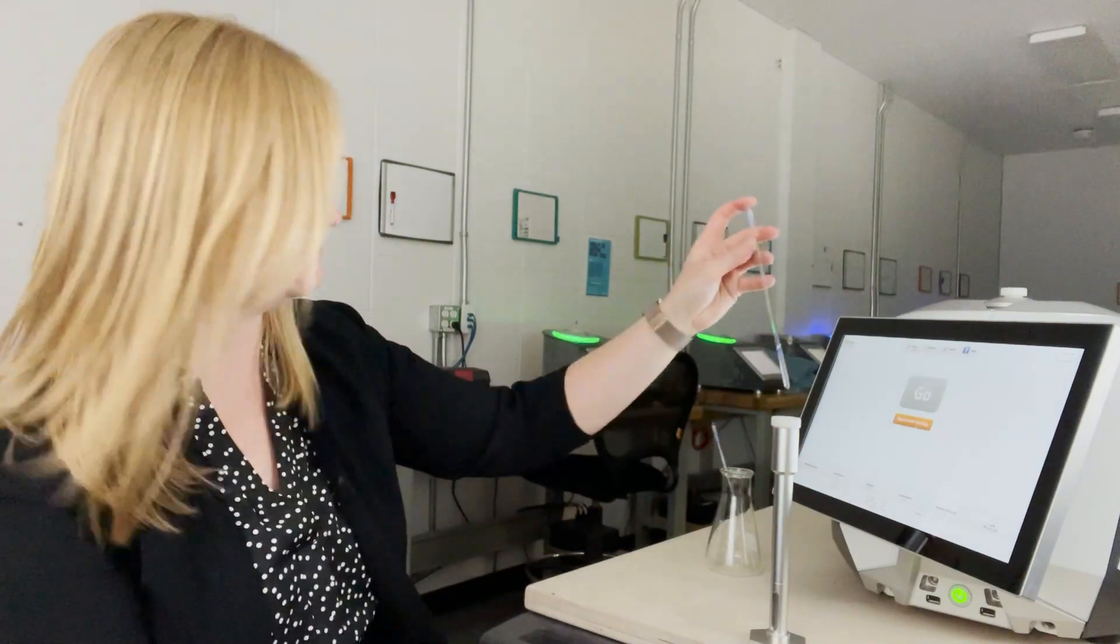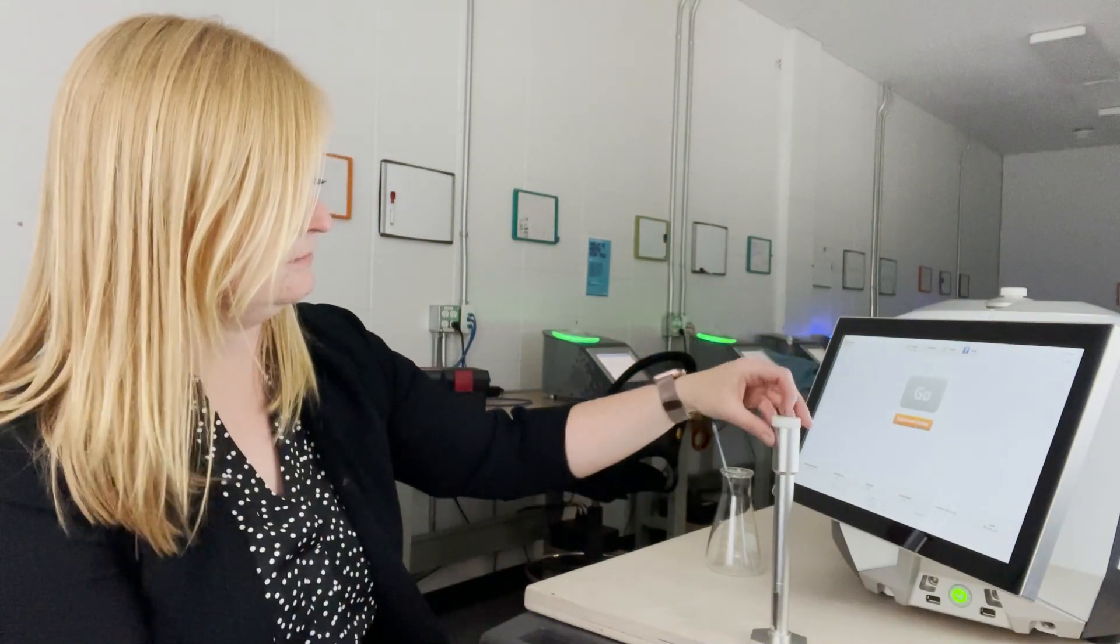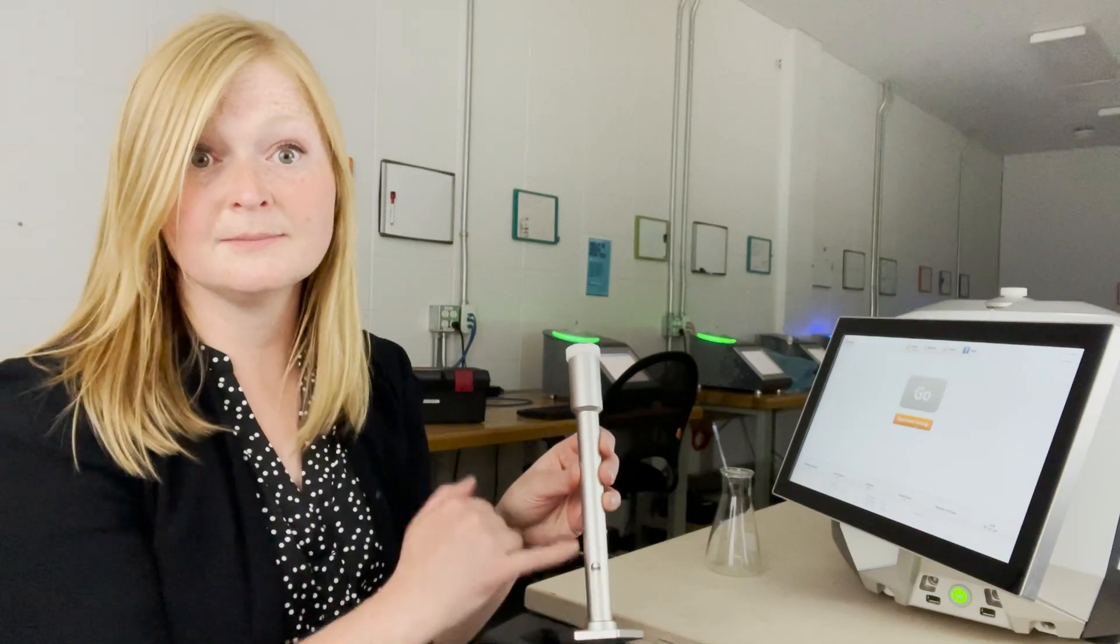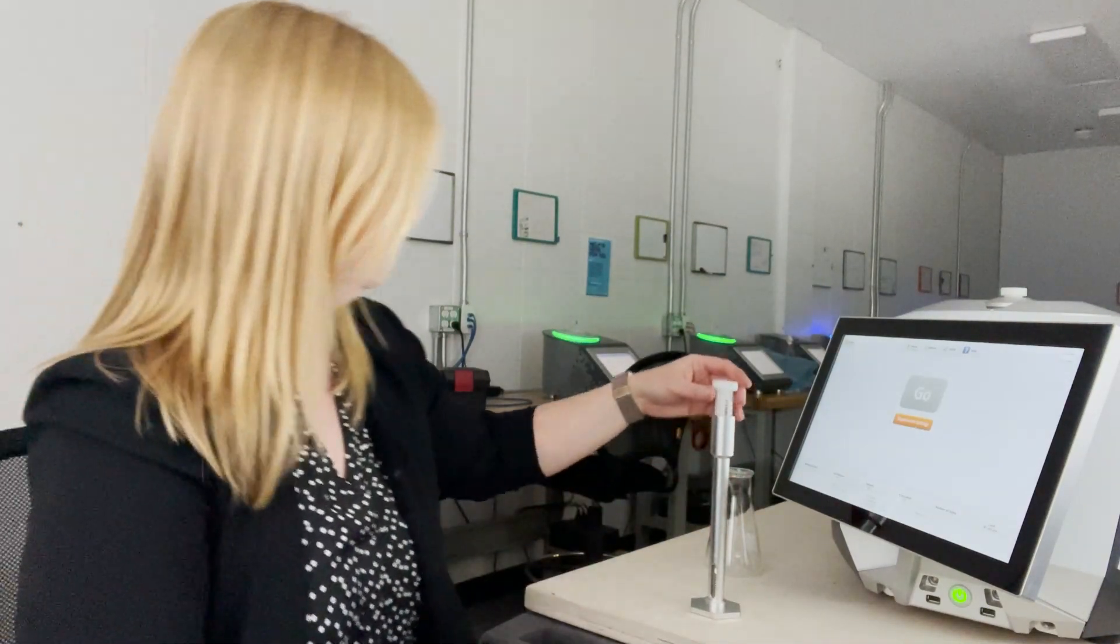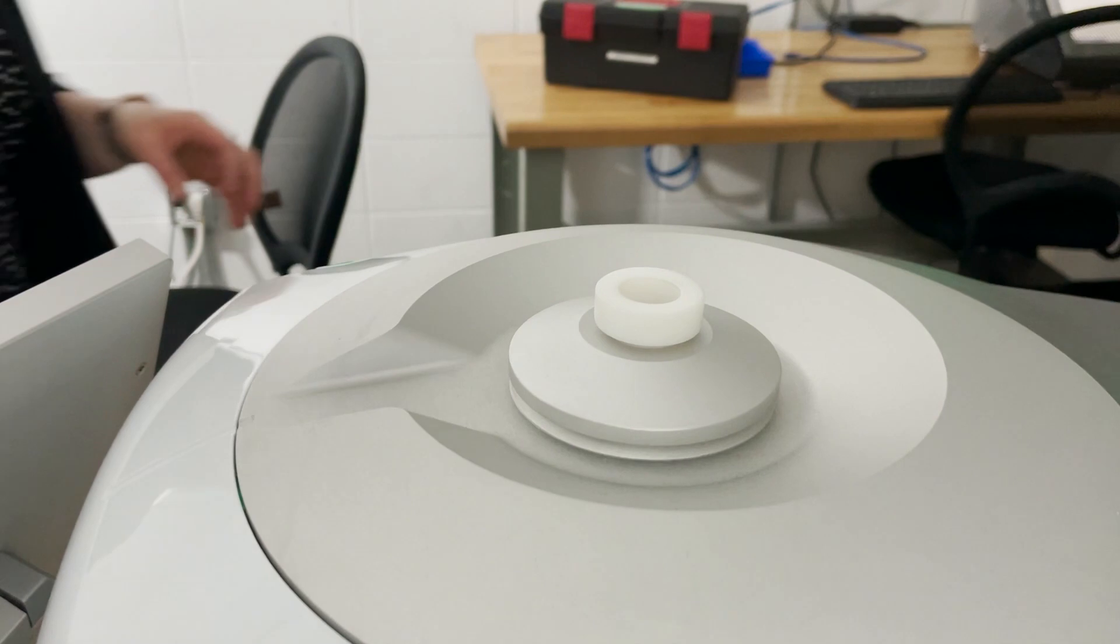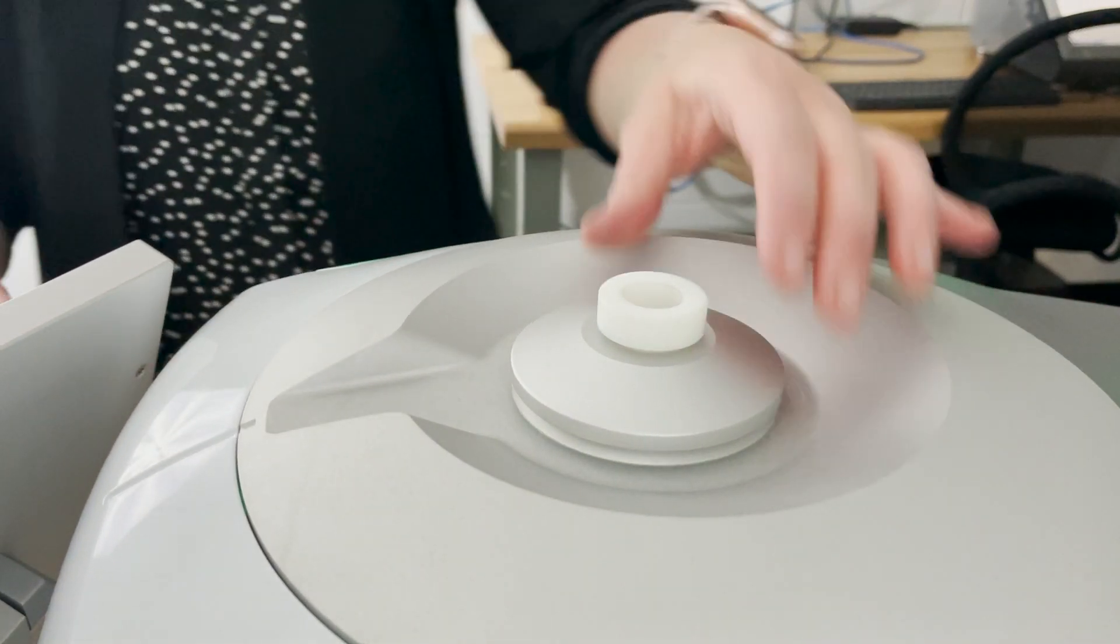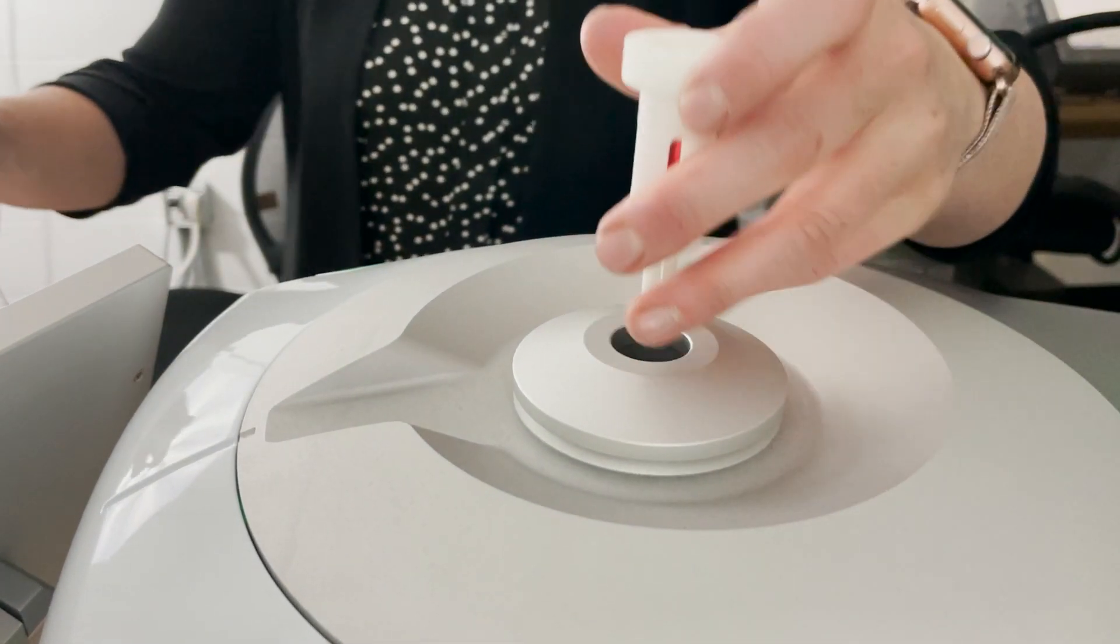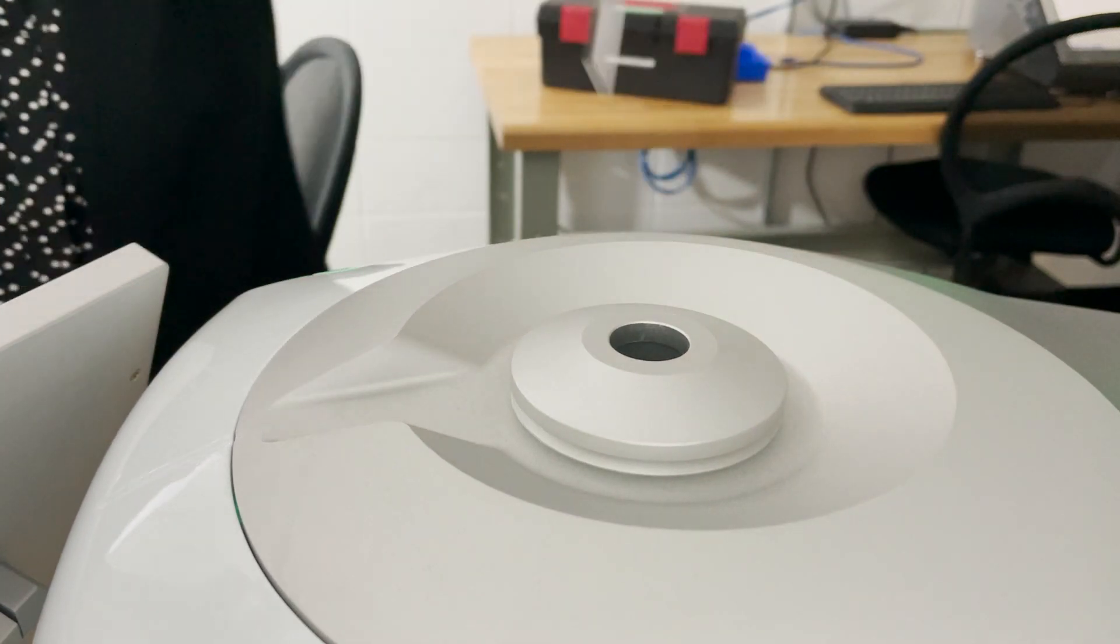If the liquid line is barely visible at the top of the window, or not visible at all, there is sufficient volume in your sample to acquire your NMR data. Once the correct depth is reached, pick up the sample from the outside edge of the sample warmer and place it directly into the NMR spectrometer.